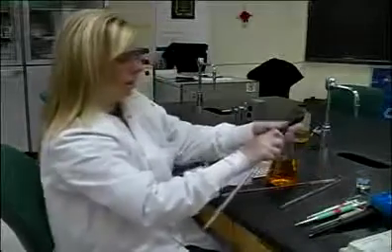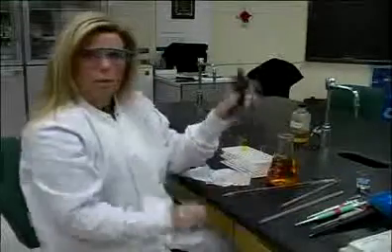When you're done, you just disconnect it, go on to the next pipette.